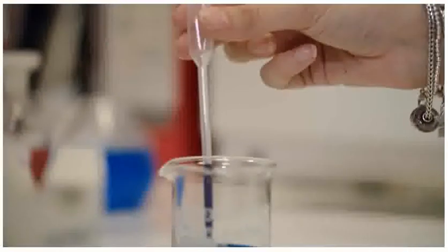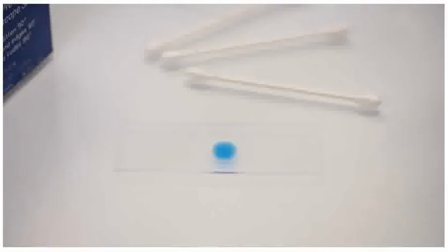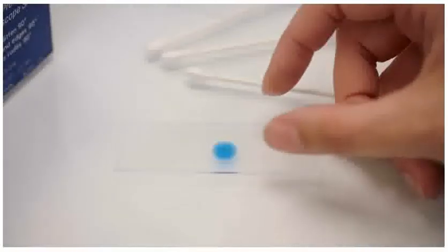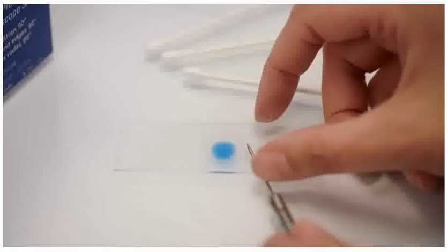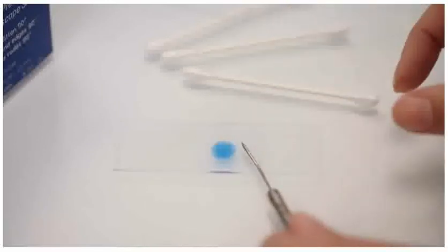A drop of methylene blue is added to the spot where the cheek cells were transferred. Methylene blue will stain each cell to make them easier to see. A cover slip is gently lowered using a mounted needle for support. Air bubbles are avoided as much as possible.